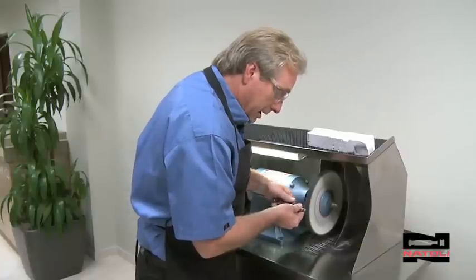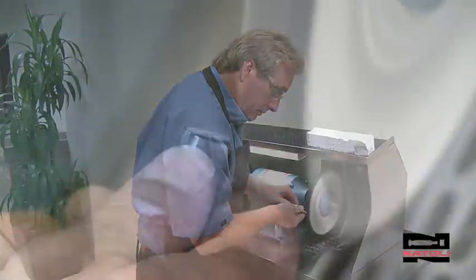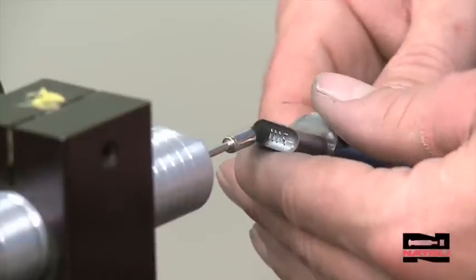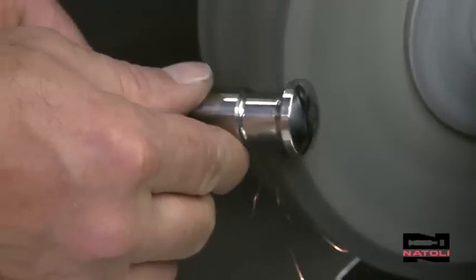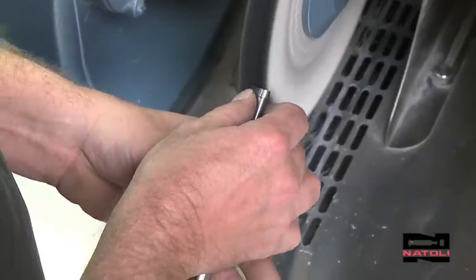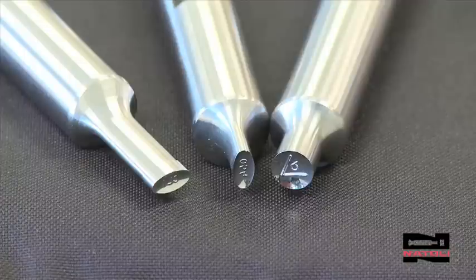That's why we produced this video expert's guide with essential industry techniques that can be mastered on-site with any tooling. This video will teach you how to maintain your tooling to minimize press downtime. This can all be done in-plant and with practice done in minutes. We believe in protecting your investment for decades to come.